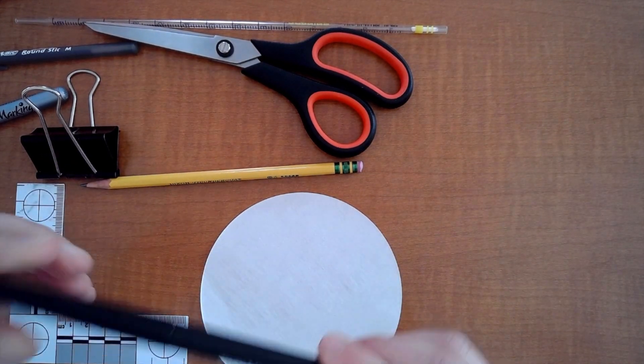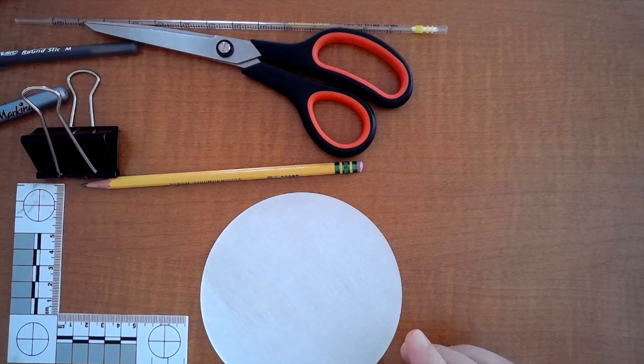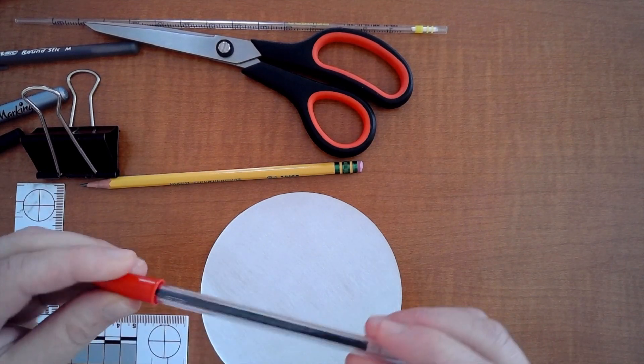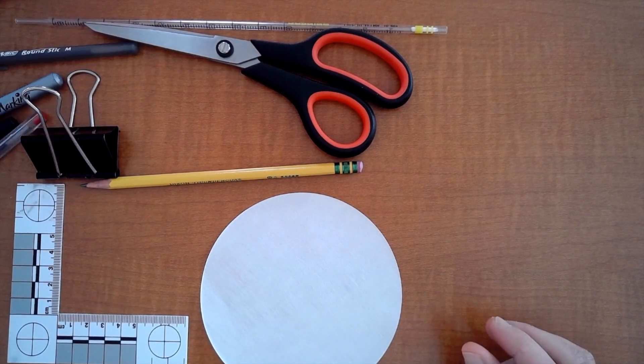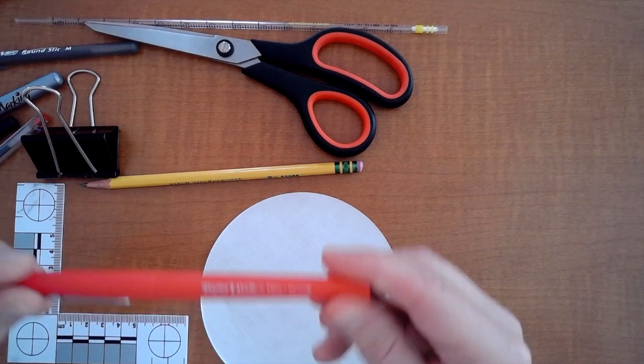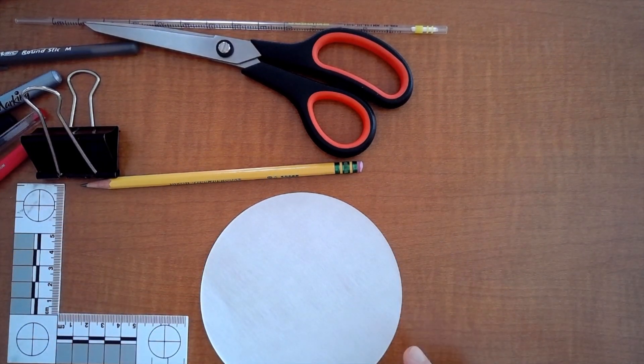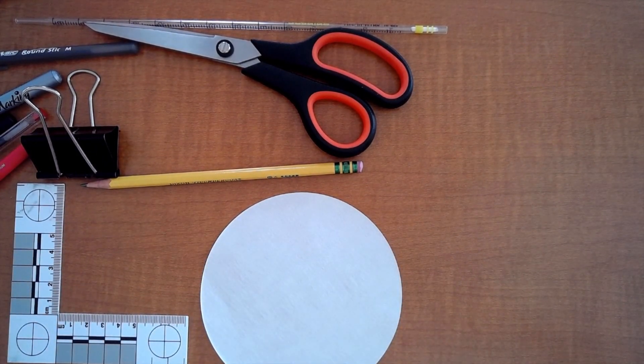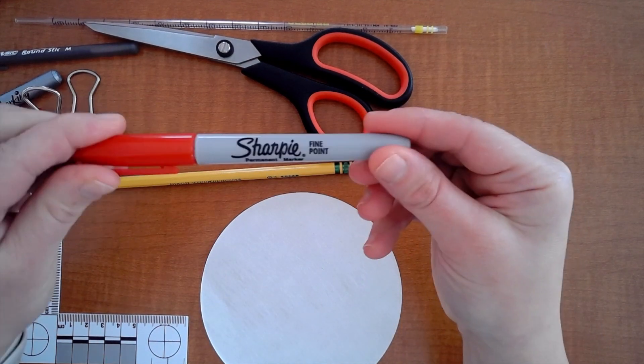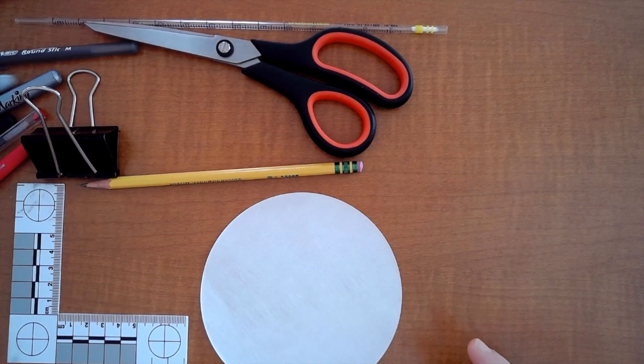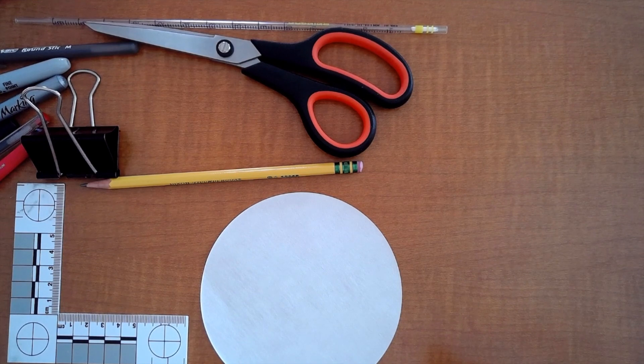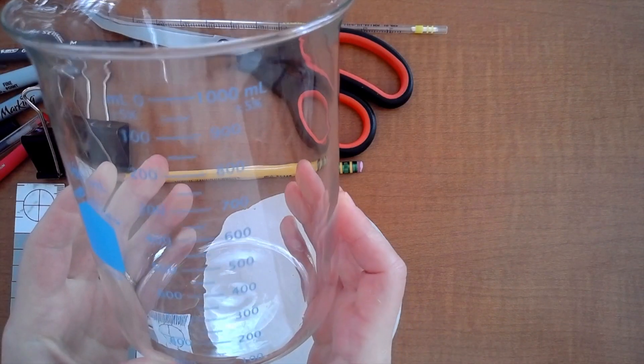The Paper Mate Flair, the Bic red pen, the Paper Mate Flair red pen, and last but not least the Sharpie red permanent marker.